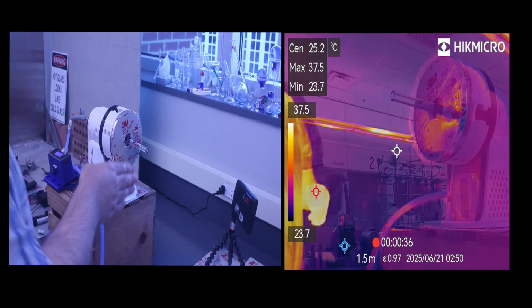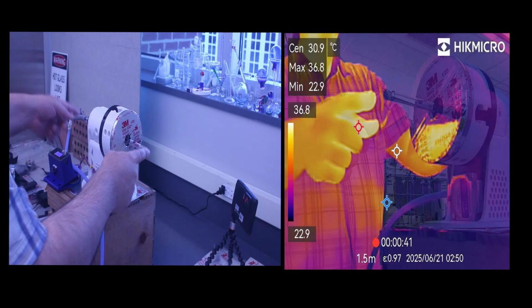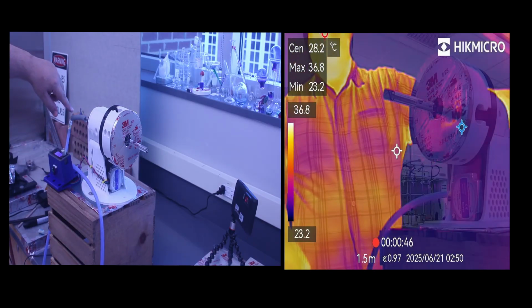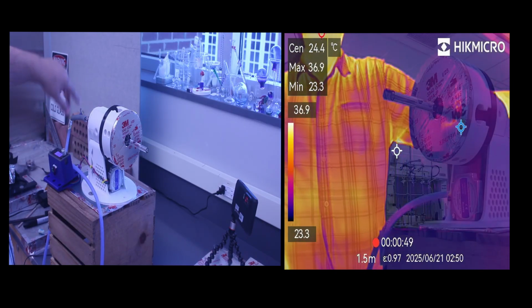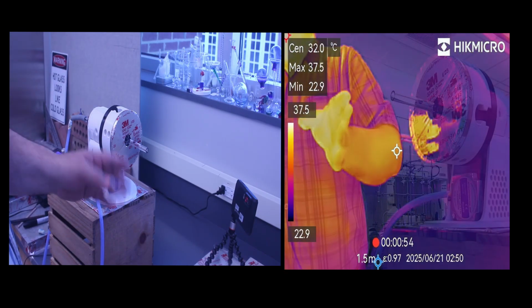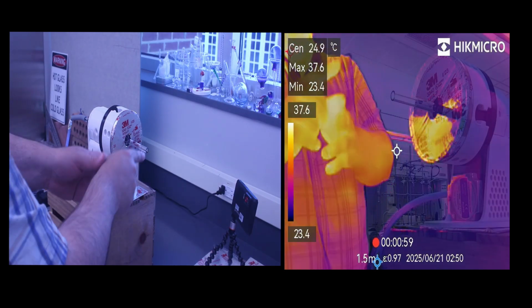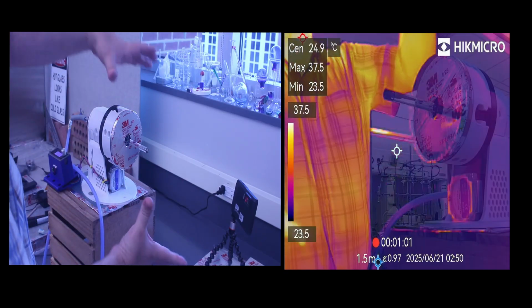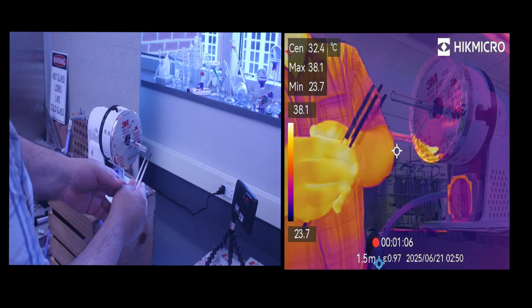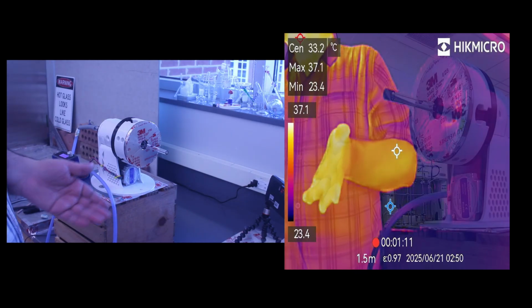I have a section of 11mm standard wall tubing that's about 13 inches long, going all the way through the lathe. At the back, I have a blow hose set up, and I'll put photos of that at the end of the video. The front of it has been cut and is sharp. It needs to be fire polished, but this time I'm going to do the fire polish, let the glass tubing shrink down, and then as it's molten, take the tweezers and remove the end, essentially sealing the tube. I'm going to make a test tube.